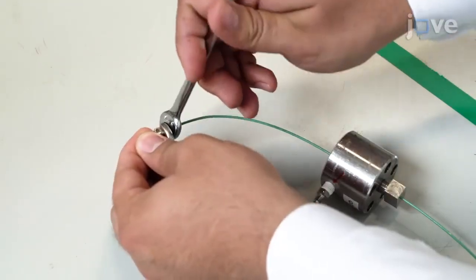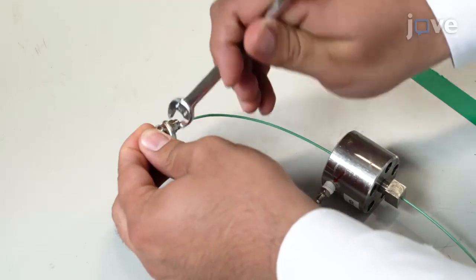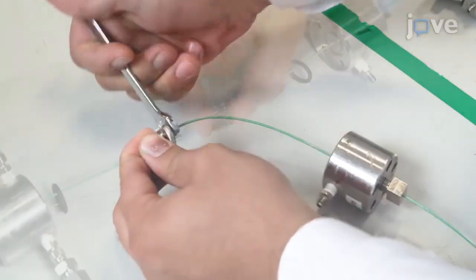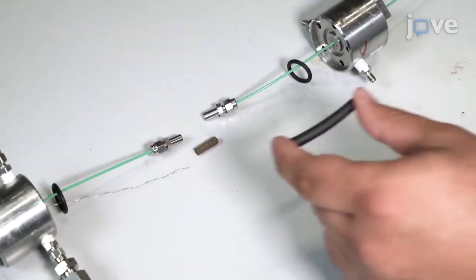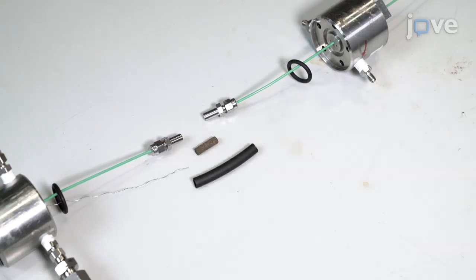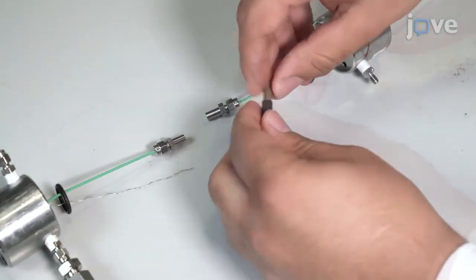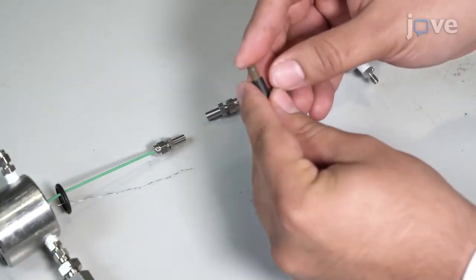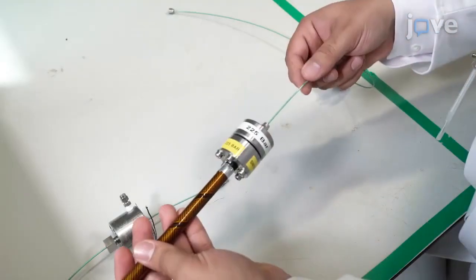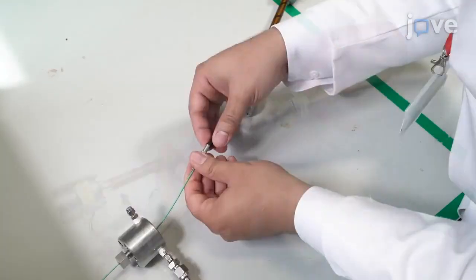Thread the holder's base with tubing that goes to the other end piece. Next, get rubber tubing long enough to cover the sample and the end pieces. Slide the sample into the tubing. Once it is inside, connect the end pieces to the sample's top and bottom.